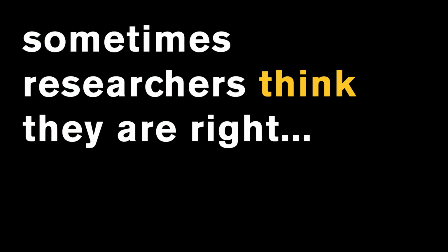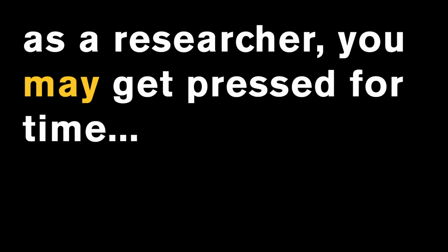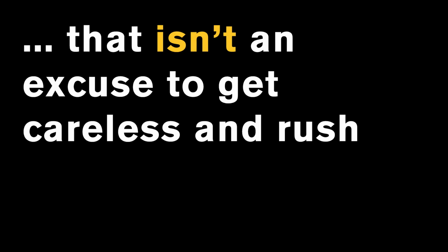Sometimes researchers think they are doing something the right way, but they can be wrong. Here are a few tips approved by the Arizona State University Institutional Biosafety Committee. As a researcher, you may get pressed for time. That isn't an excuse to get careless and rush through your work.